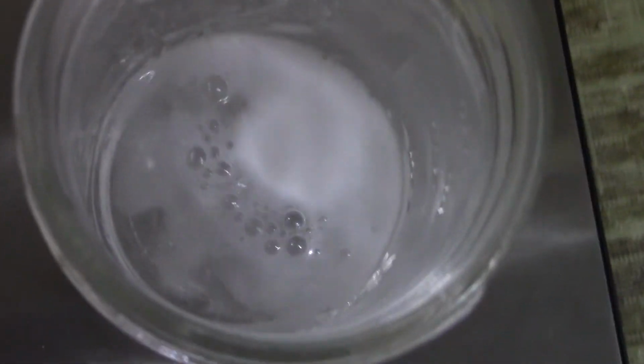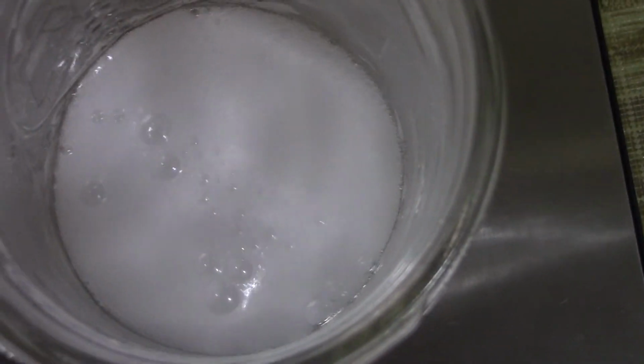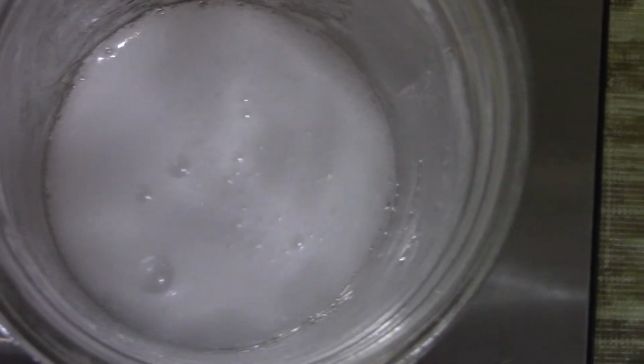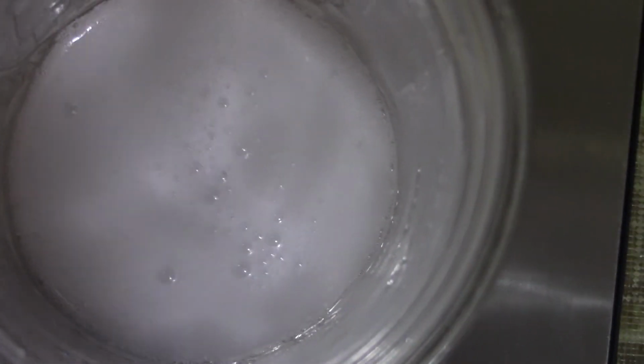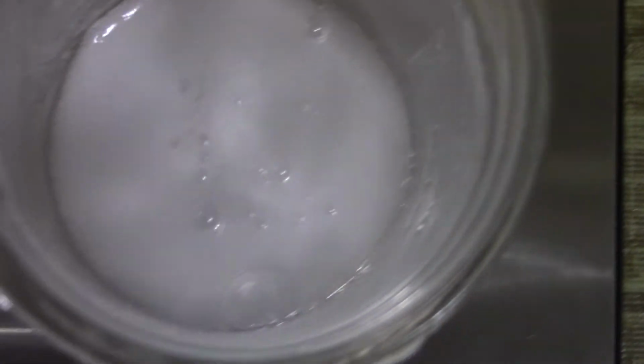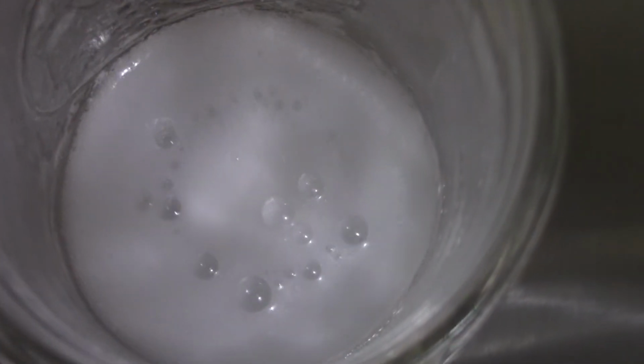And as you can see, which I'd hope you'd expect, the Alka-Seltzer is dissolving in the liquid water and vinegar mixture. Pretty typical evidence of a chemical reaction with the evolution of gas bubbles. Check the laboratory handout for the reaction. We're going to go over it in a little bit, but those gas bubbles are CO2, and that's the direct product of the decomposition of our carbonic acid, which we've talked about in class.